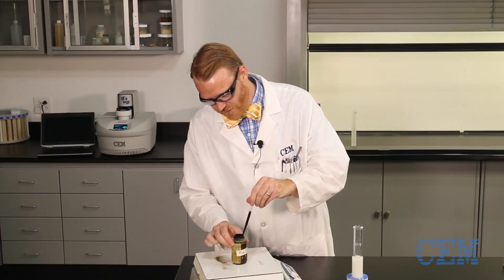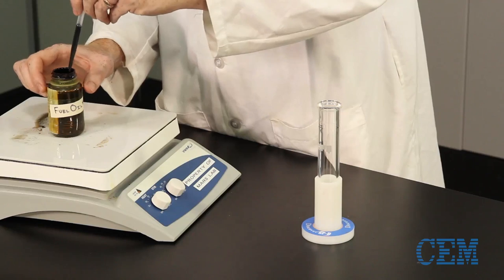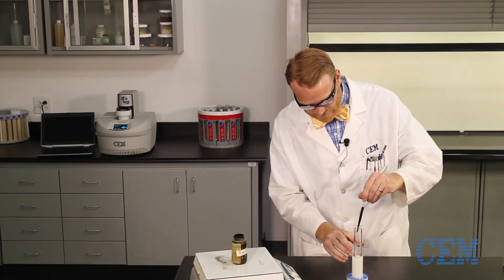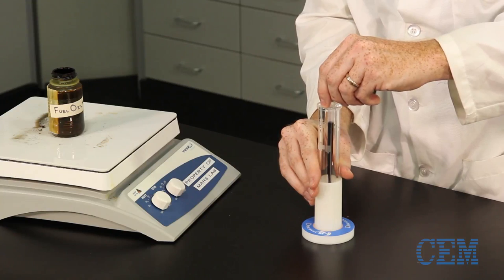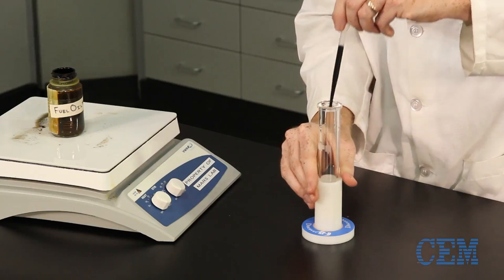So we're going to get about a quarter gram of this and we're going to put it in our vessel making sure to try not to get it on the sides. There we go.